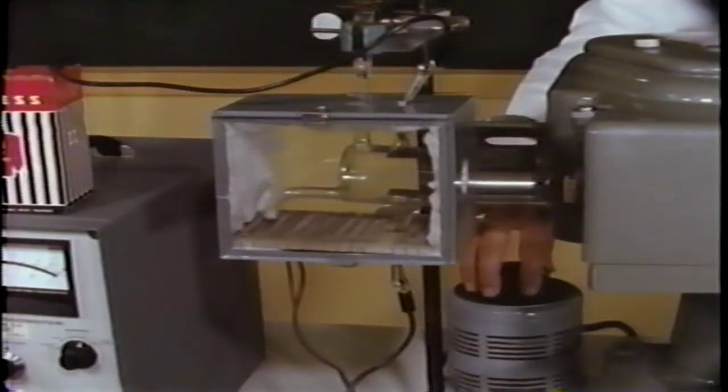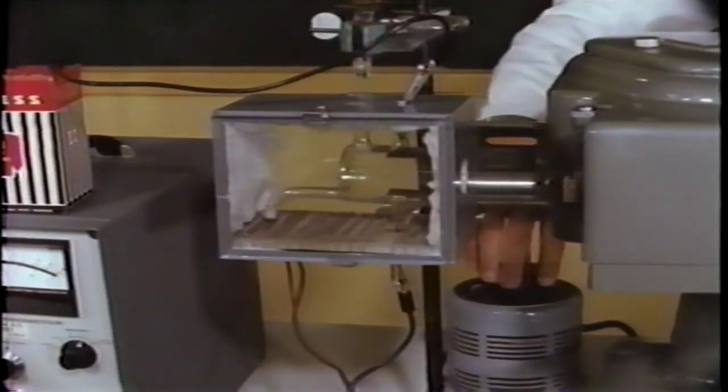Now we have a good vacuum, so we'll turn on the oven and heat the sealed-off cell. The sodium melts and starts vaporizing to gaseous sodium. The energy of the light, which shines through the oven and cell windows and into the gas, will vary. We begin with low-energy red light. Watch the meter while we slowly increase the frequency of light entering the sample. Yellow, green, blue, ultraviolet.